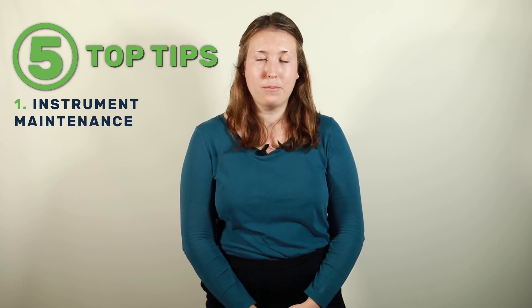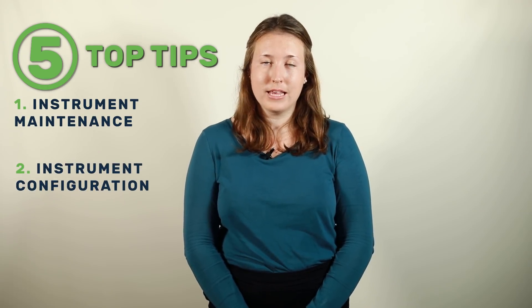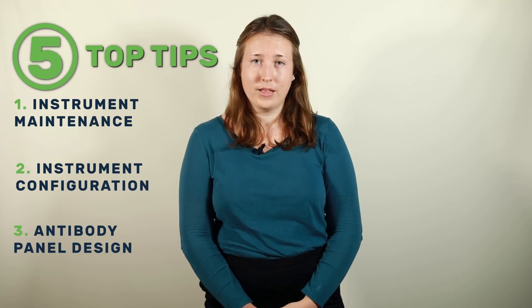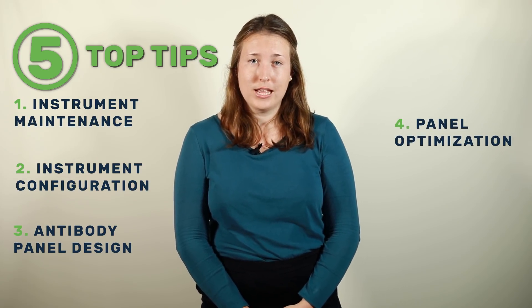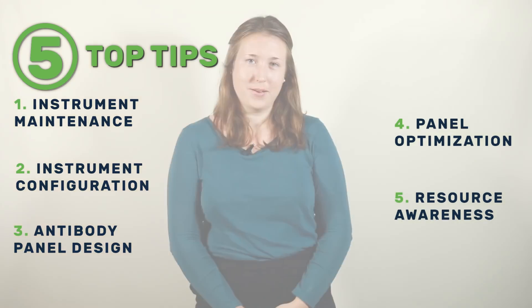As part of this feature we explore five top tips of how to set up and run any flow cytometry assay. These include how to maintain and monitor your instrument, knowing your instrument configuration, taking the time to design your antibody panel, how to optimise your panel and how to control usage and knowing the resources you have if further validation is required.